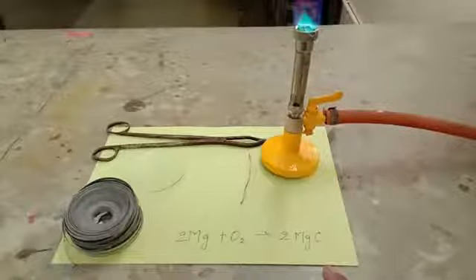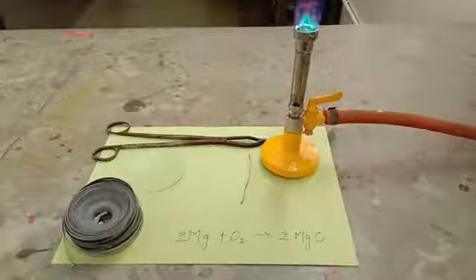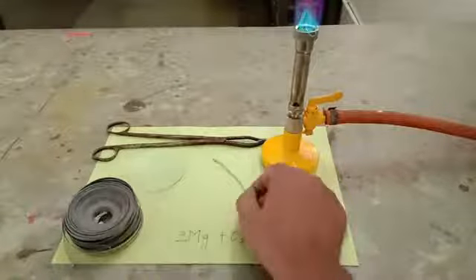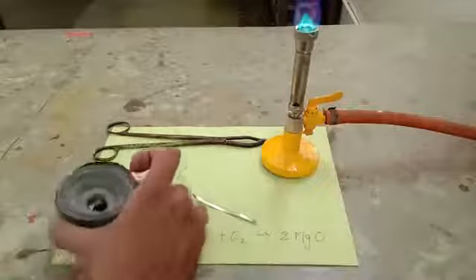Today I am going to show you the demonstration of a chemical reaction that is burning of magnesium. Here I have a strip of magnesium which is cut from the magnesium ribbon.